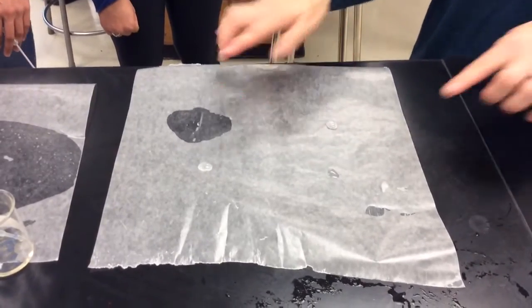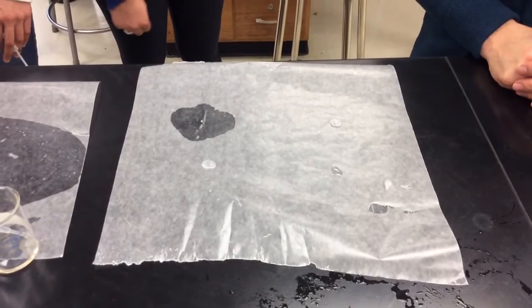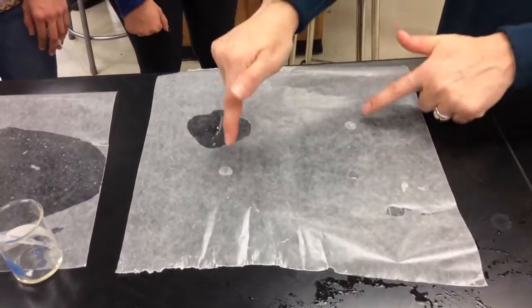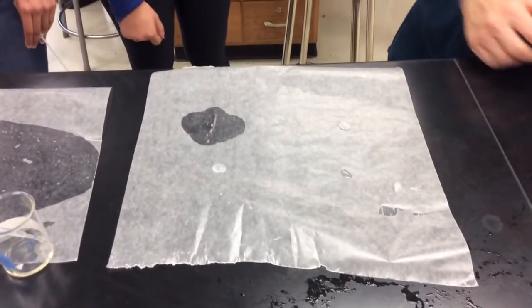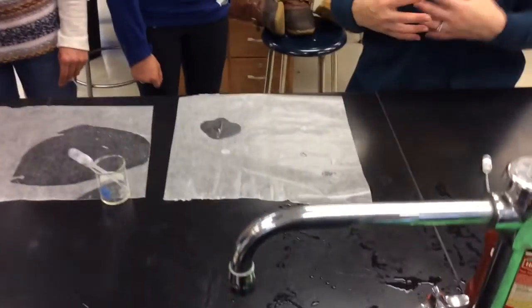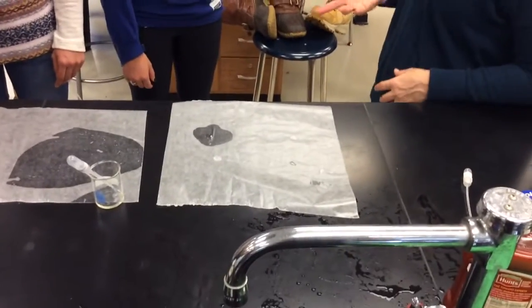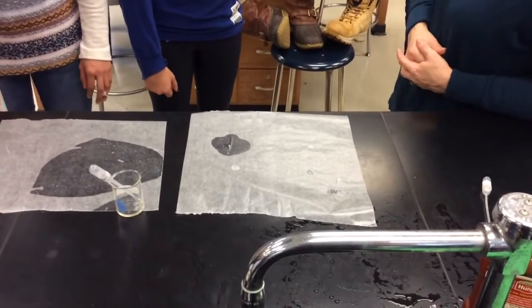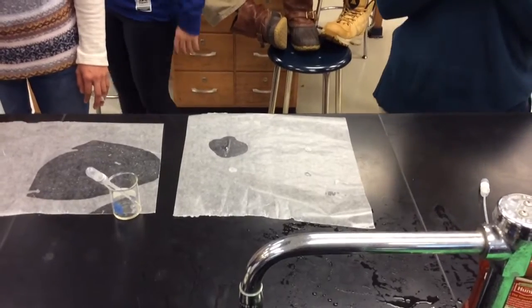Wax is nonpolar. What does that probably tell us about these two liquids? They're also pretty nonpolar, or at least much less polar than these two guys right here. Does that make sense? Because things will mix with each other when they have very similar attractive forces, and they have a tendency not to mix with each other when their attractive forces are very different. Does that make sense? All right, so that, you guys, is number 6. We're looking at surface tension.